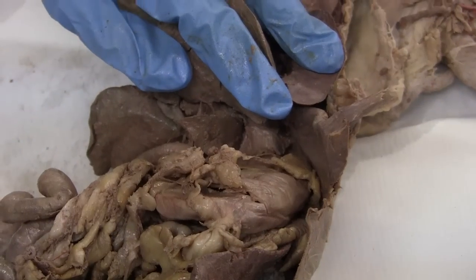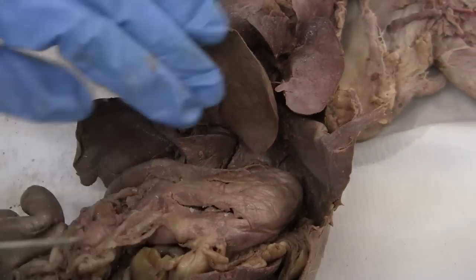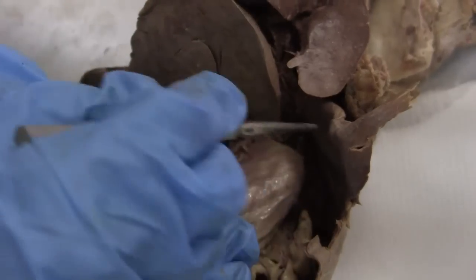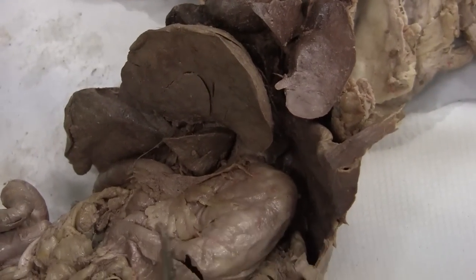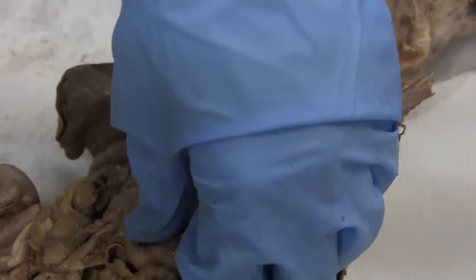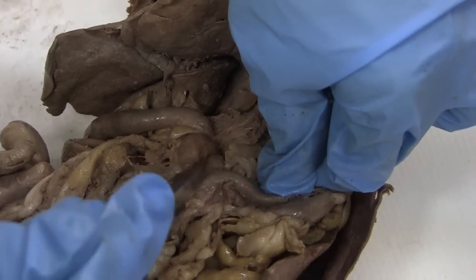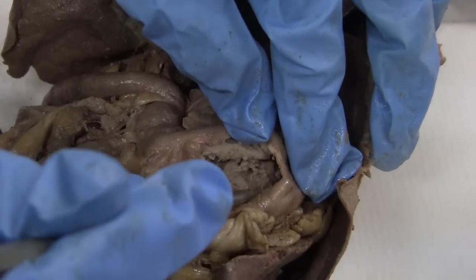We did the pancreas. Small intestine. What about the parts of the stomach? The cardia is inside, right about here, but it's inside the stomach. The fundus is this. The body is most of it here. Pylorus — that's where it connects to the small intestine, it's kind of that bulge. The rugae is inside; I don't know if you can see that, but the ridge is inside.